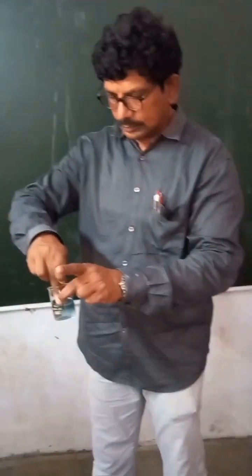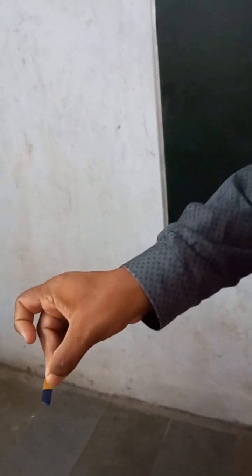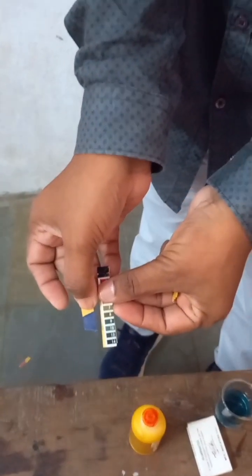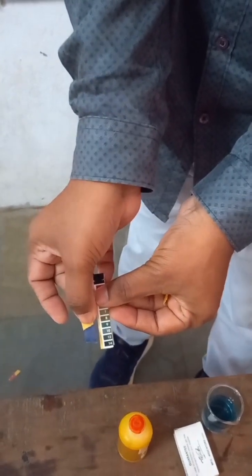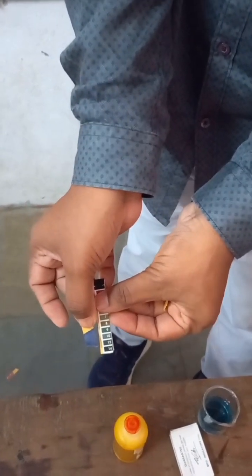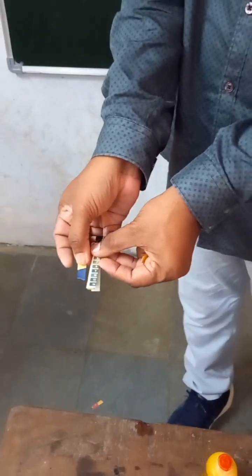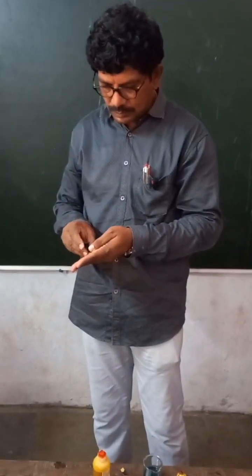What is this color? Blue color. Compare this — what is the approximate pH? Nearly 10. So it is a base whose pH is 10.